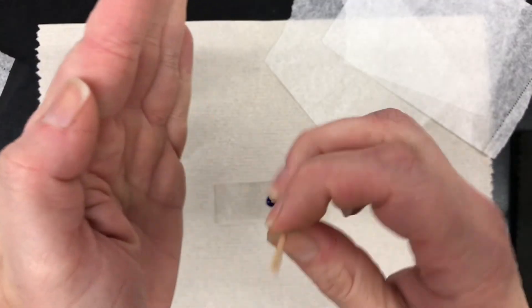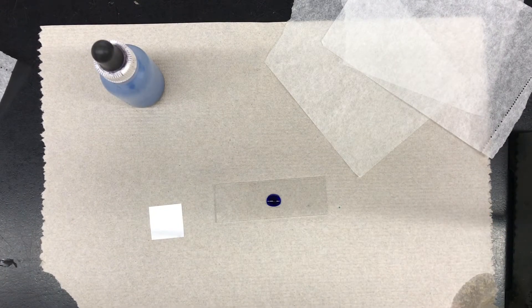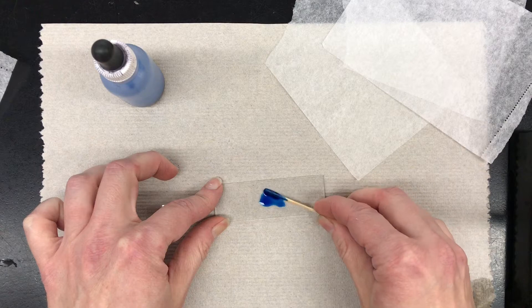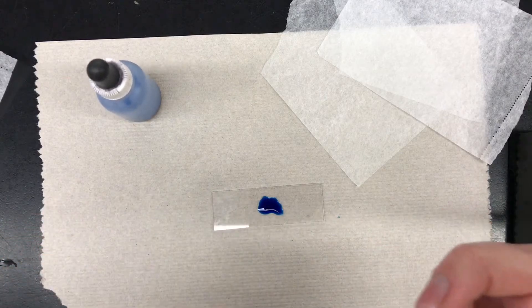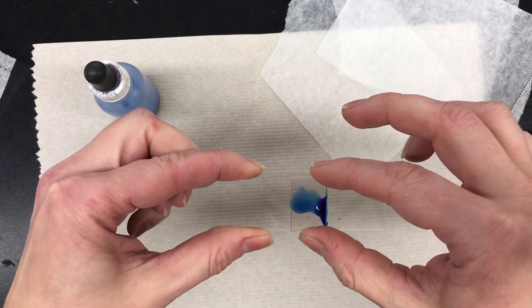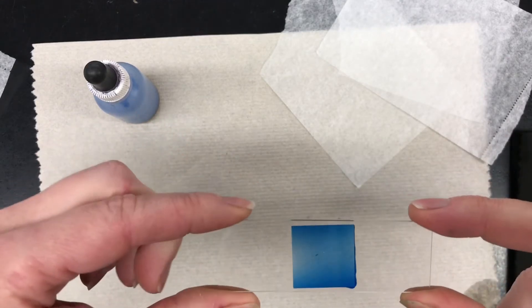Inside your mouth, take the toothpick and rub it on the inside of your cheek. There are now cheek cells on this toothpick. Take the toothpick and roll it around in the methylene blue, then throw the toothpick in the garbage. Pick up your cover slip, hold it at a 45-degree angle, touch the methylene blue a little bit, then slowly lower it down and release.